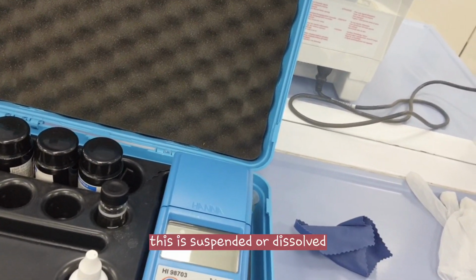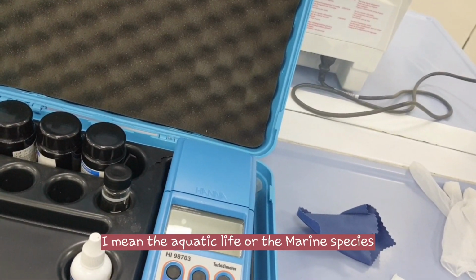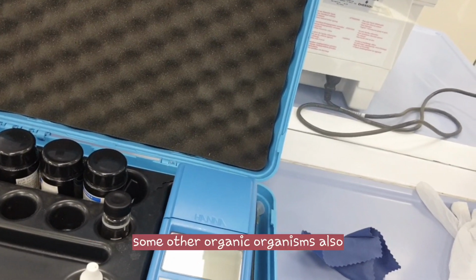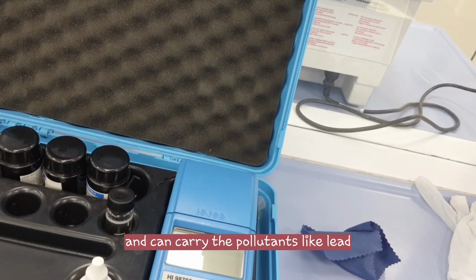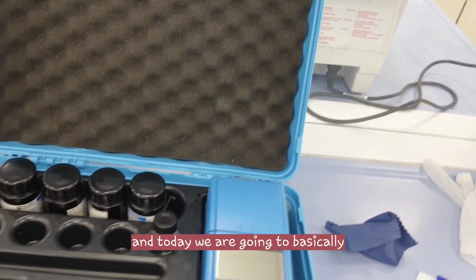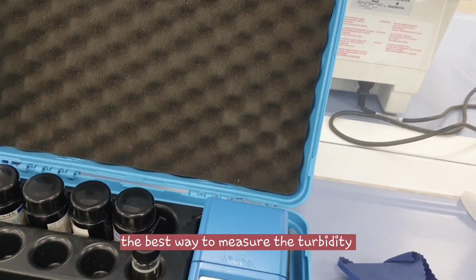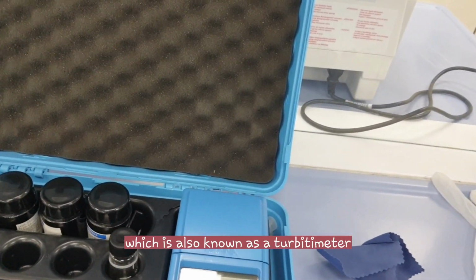Specifically, suspended or dissolved particles can adversely affect aquatic life or marine species. Suspended particles that cause turbidity can block light from reaching aquatic plants and other organisms, and can carry pollutants like lead, mercury and bacteria. Today we are going to measure the turbidity of water. As I already told you, this is a turbidity meter, and normally the best way to measure turbidity in a wide variety of samples is a nephelometer, also known as a turbidity meter.